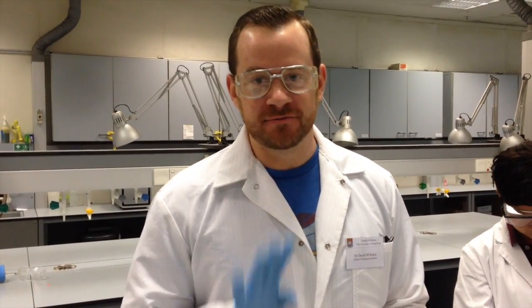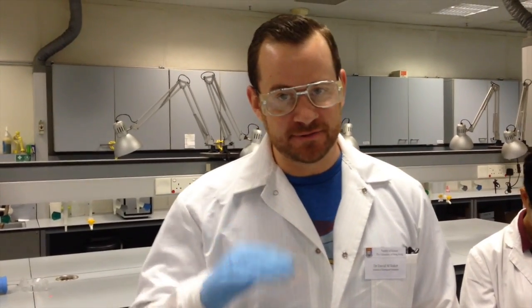All right, welcome to the next laboratory session. At the beginning of this lab session, we're actually going to take a short field trip to Victoria Harbor to collect 4 samples of water at different depths right by the central wastewater treatment facility. What fun. After we collect those samples, we're going to bring them back to the lab and conduct a variety of different types of analyses.